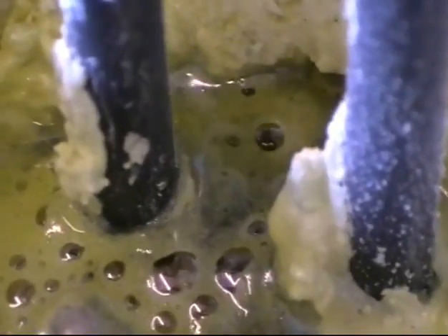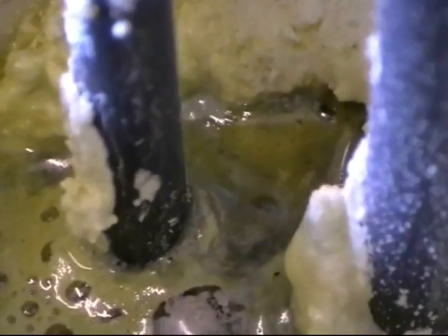If I wet some universal indicator paper, you can see at the left hand electrode we've got bubbling effervescence — there's a gas clearly being produced. I can see that it's a brown gas, you may not be able to make that out. Taking some damp indicator paper and placing it over towards that side, we might see that it's an acidic gas — you can see it beginning to turn reddish there. So it's certainly an acidic gas.